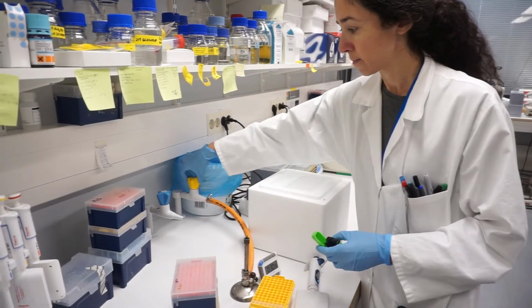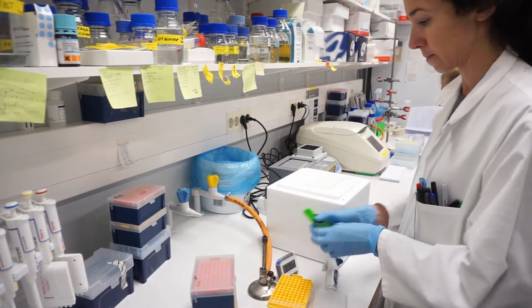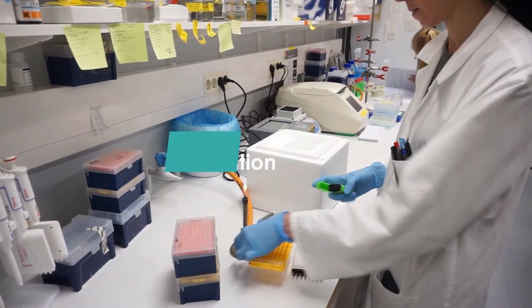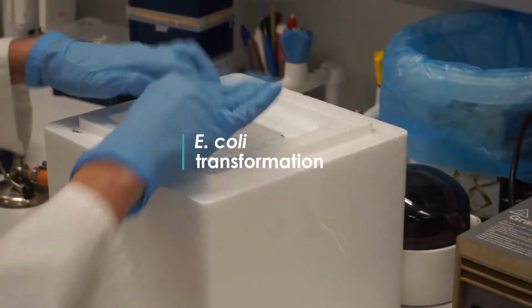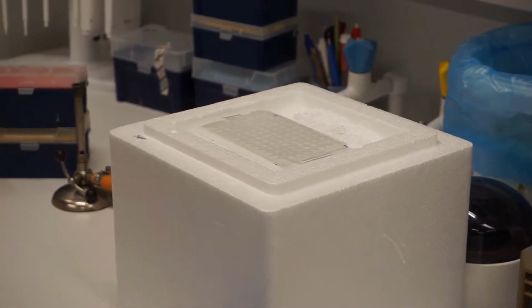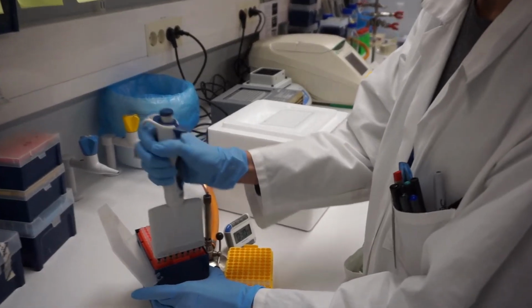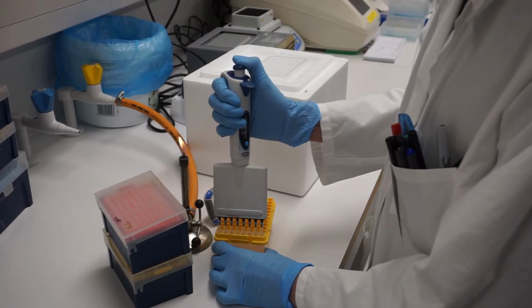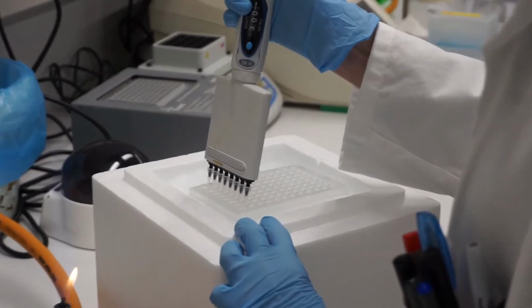Prior to performing this experiment, E. coli competent cells are made, aliquoted, and stored at -80 degrees Celsius. Thaw competent cells on ice. Add 3 microliters of expression plasmid to each aliquot of competent cells.